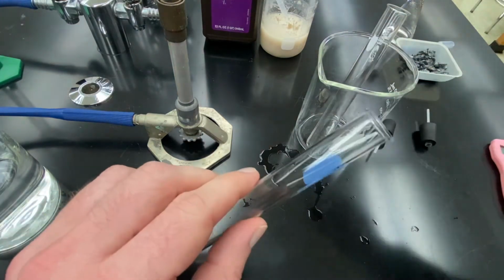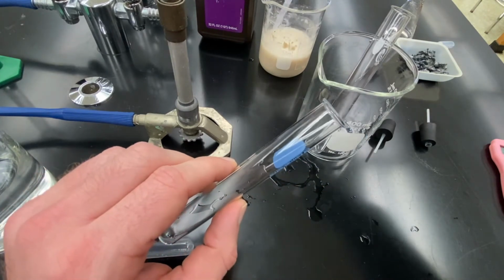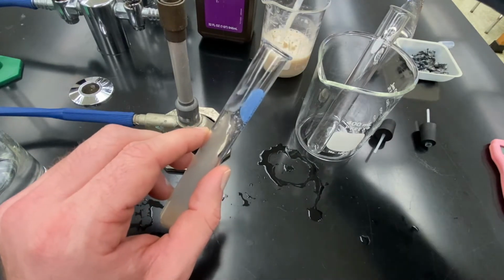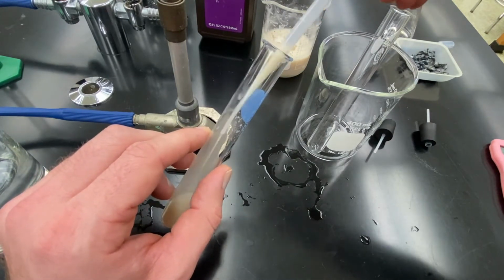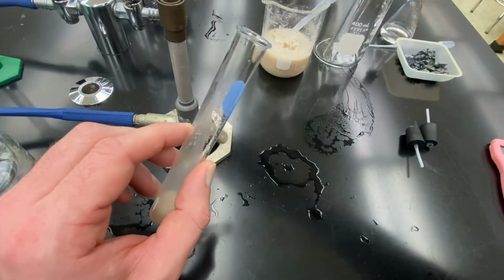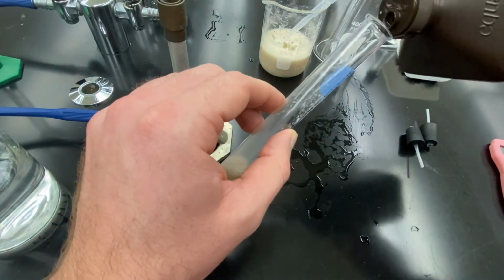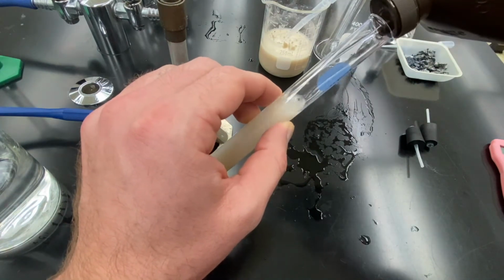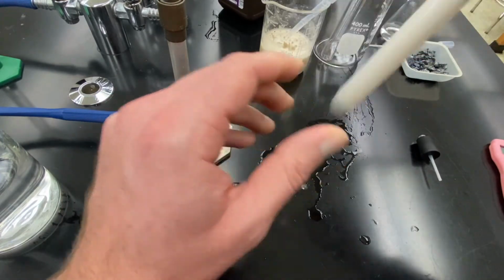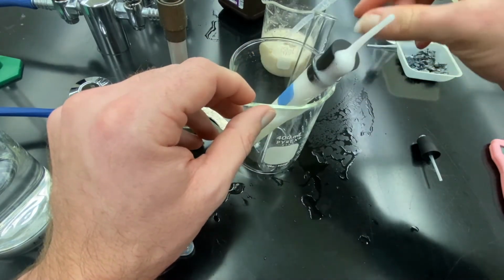So what I'm going to do is take some yeast. So this is suspended yeast. So it's a yeast suspension. I'm going to take roughly 2 pipettefuls. Yeast is a fungus that decomposes hydrogen peroxide, producing water and oxygen. And so if I take some hydrogen peroxide and add it to my test tube, filling it up most of the way, it will start reacting, giving me some oxygen. And so you could see that one's bubbling out, creating all kinds of oxygen.